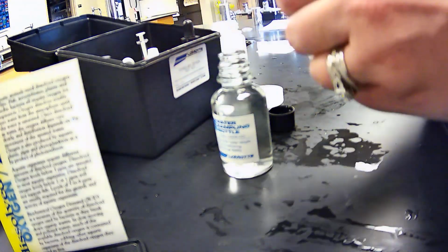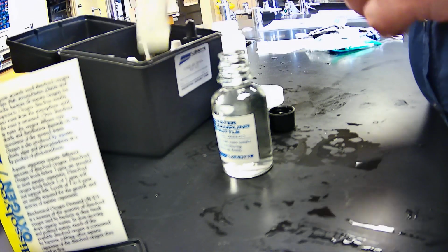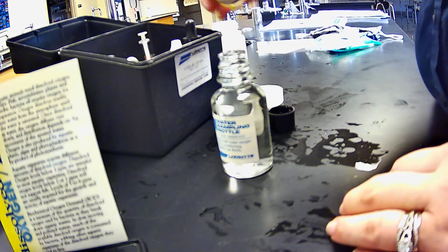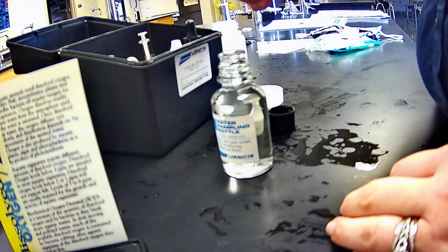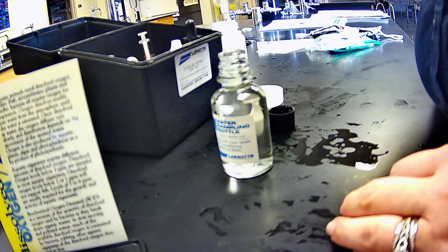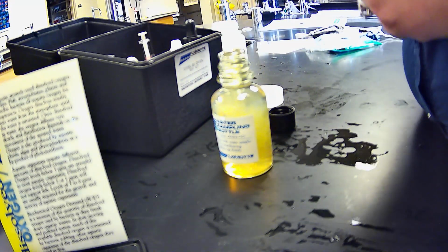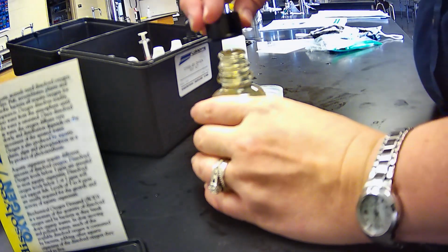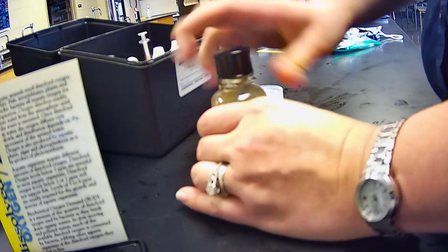I think it's so important for students to know how to do all the different methods. So that's why I want to teach you guys how to do this. And then 8 of our alkaline potassium iodide azide, and 8 of those. So 1, 2, 3, 4, 5, 6, 7, 8. Okay. And then we're going to place the cap and mix, and then watch the precipitate go through.